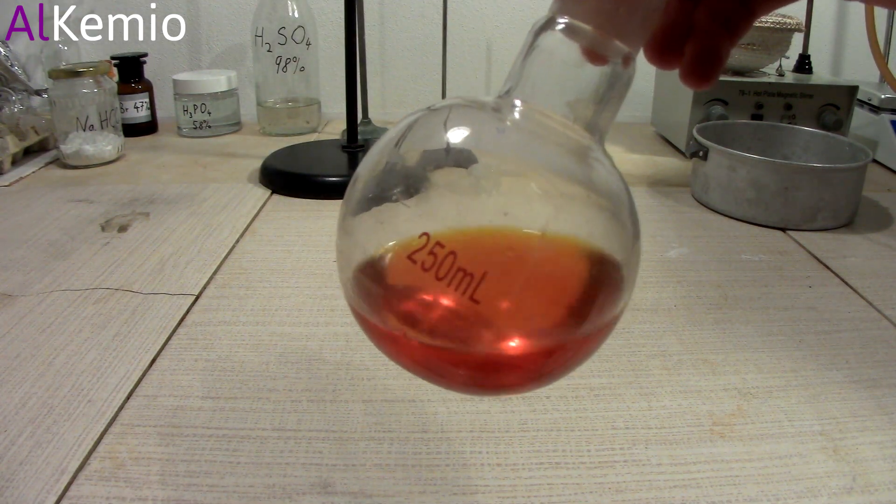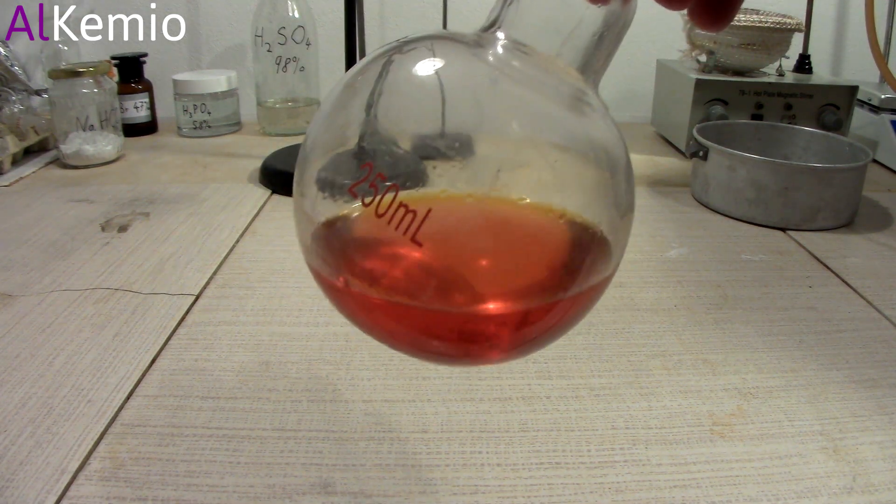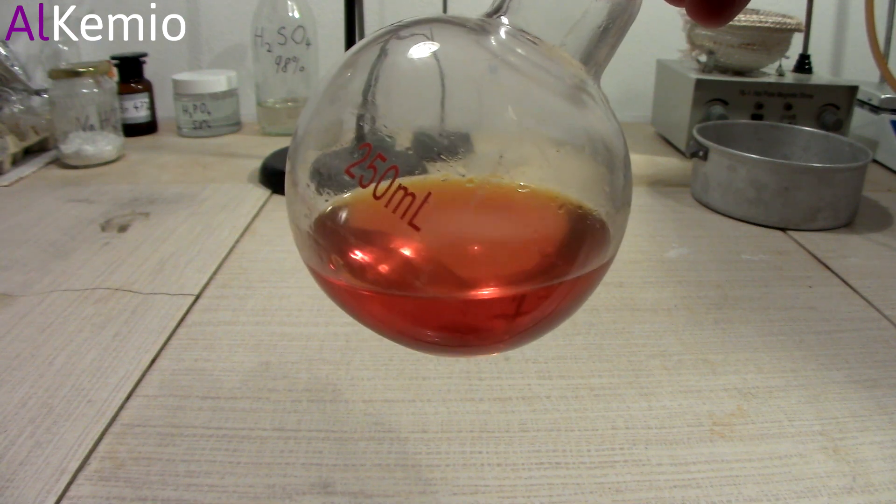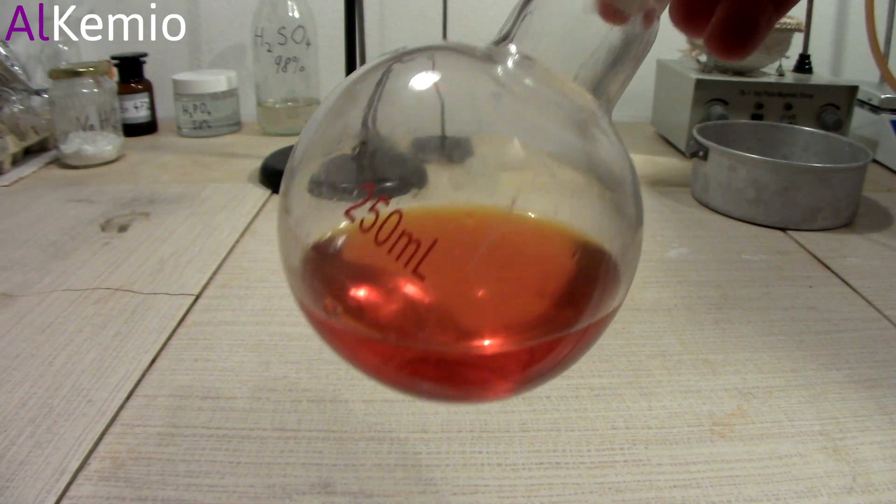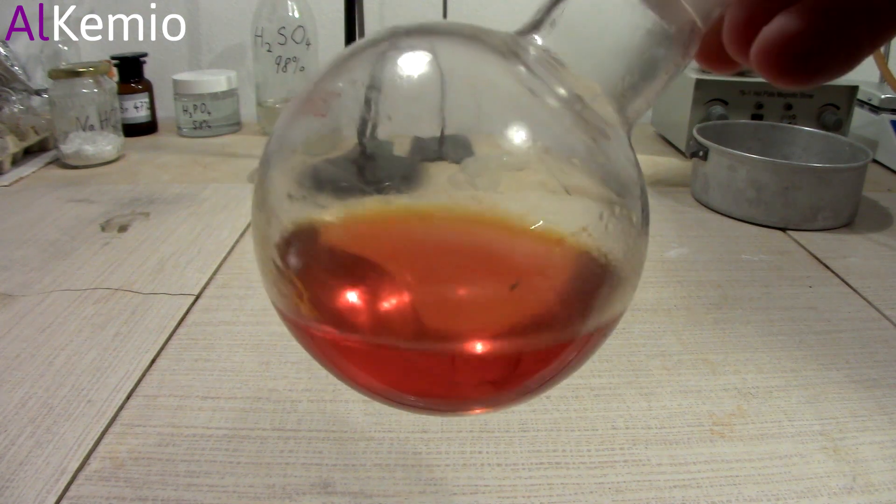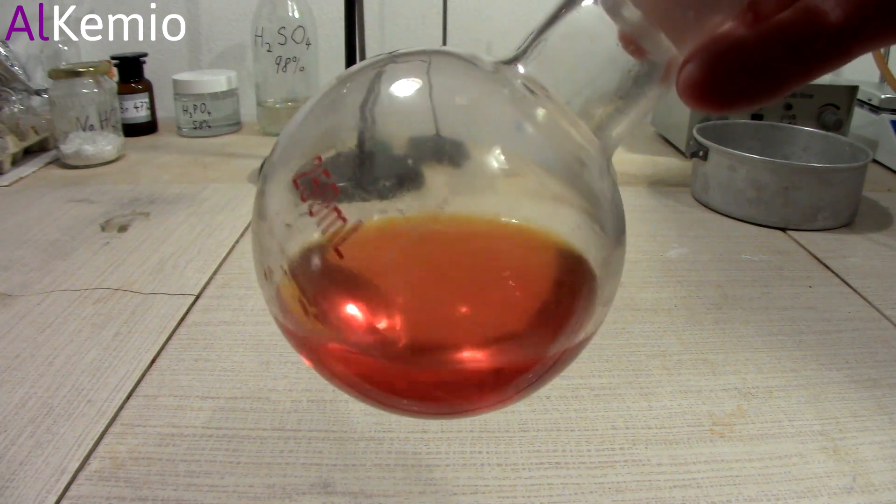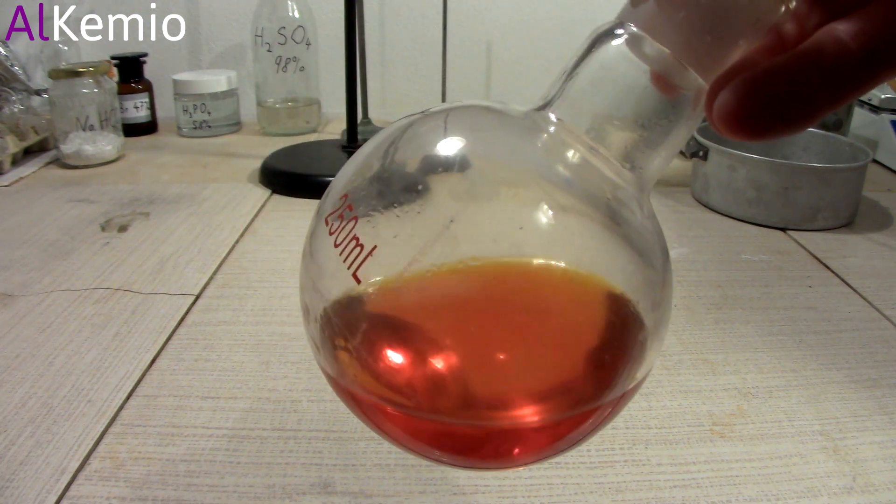This is the product of distillation. Because benzene is a clear liquid we can clearly see that there is some orange contamination. We will need to get rid of this.